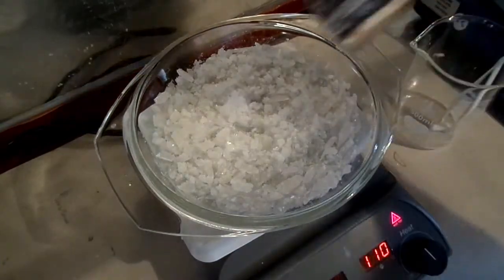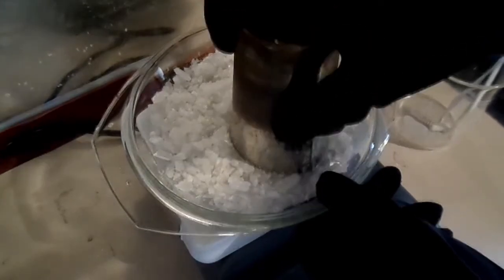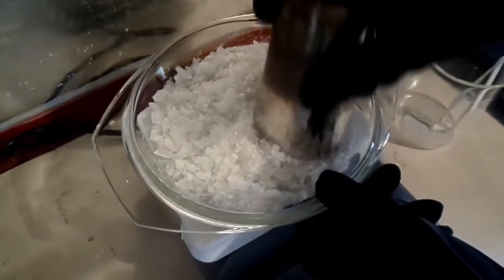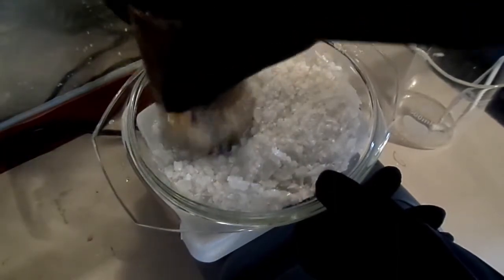Using a metal cup, I proceeded to crush the crystals, trying to form something resembling a powder. In total, I kept the hot plate heating for a full 24 hours in order to dry the product.